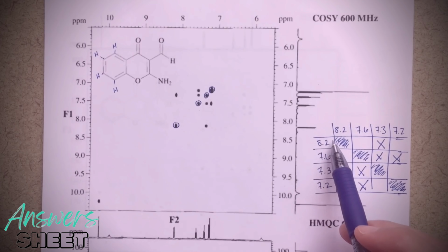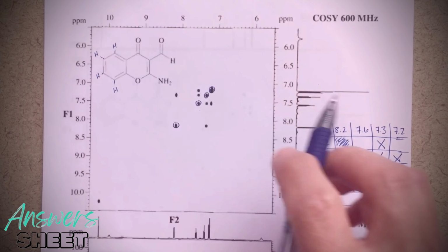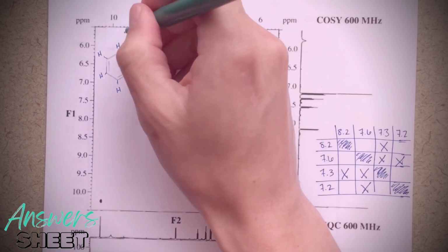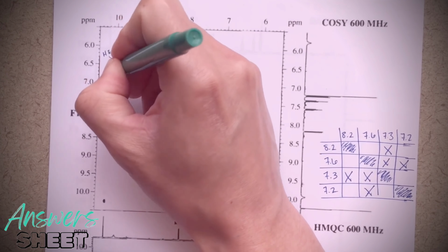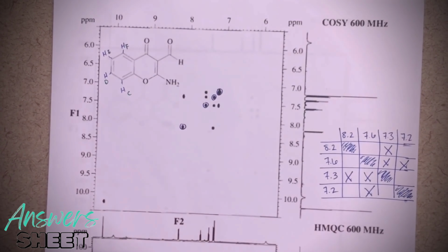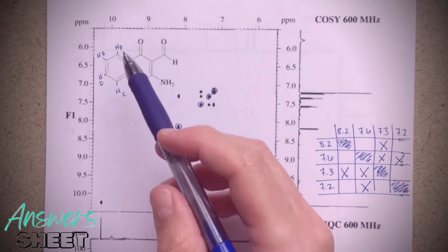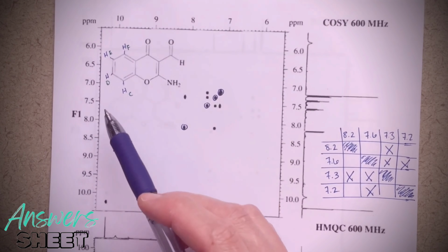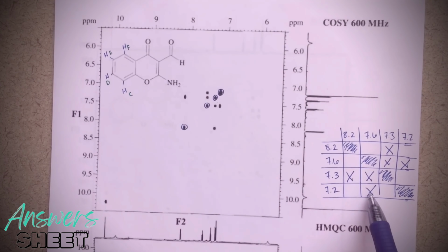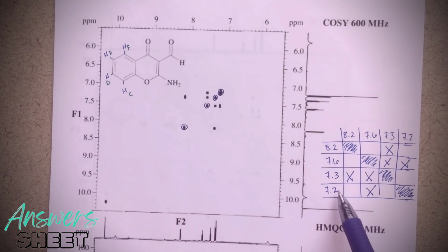Essentially what that's telling us is that the peak at 8.2 is either this peak here that we've labeled as F, so let's keep our colors straight here. So this is F, this is E, this is D, and this is C. So what we've figured out so far is that the peak at 8.2 has to be either F or C. And the reason for that is that it's only correlating with one other of the signals. Same thing for 7.2. It's only correlating with 7.6. So C and F, we can tell is going to be 7.2 or 8.2.